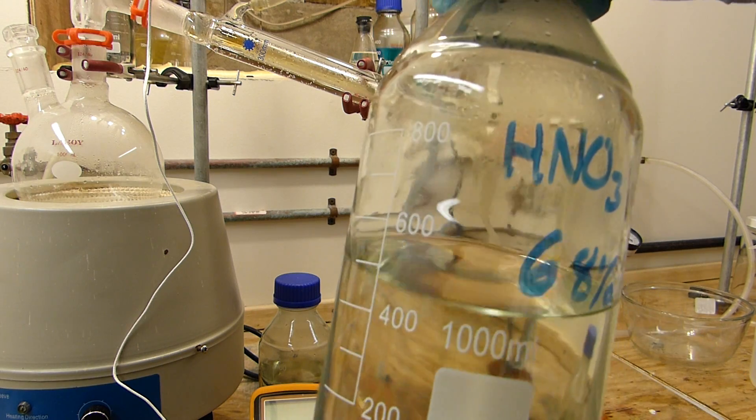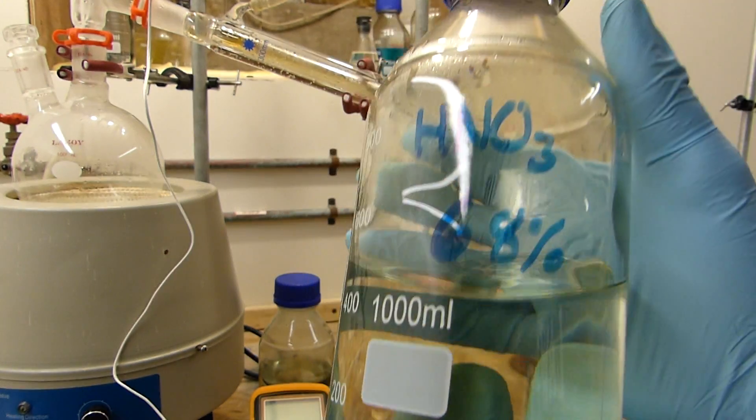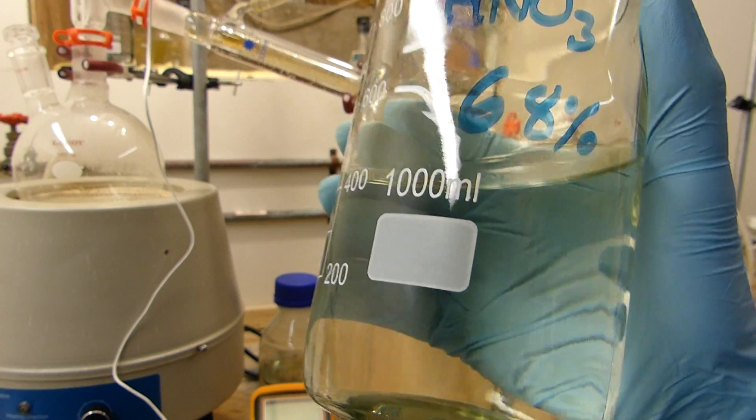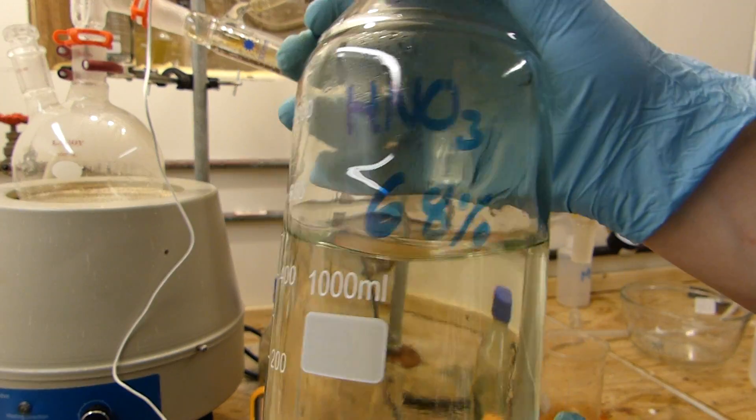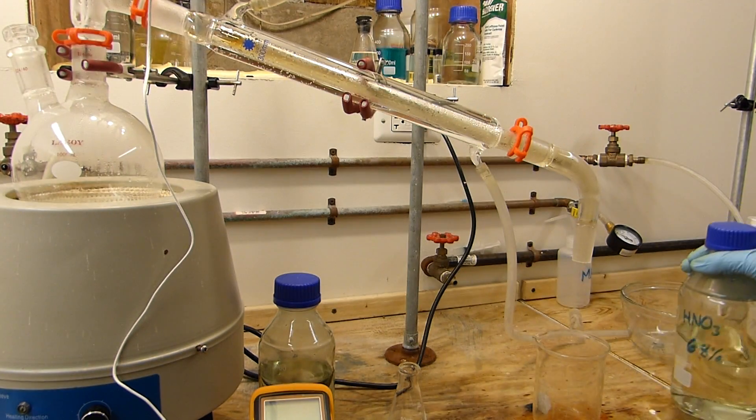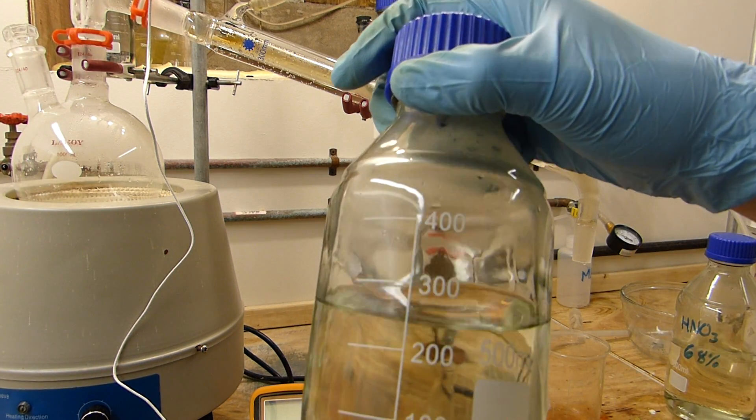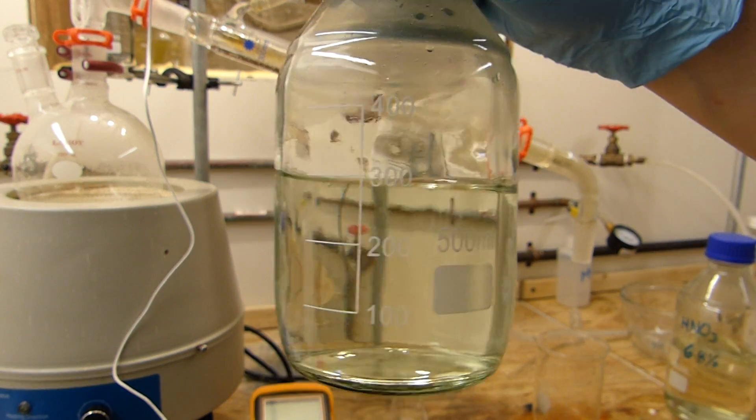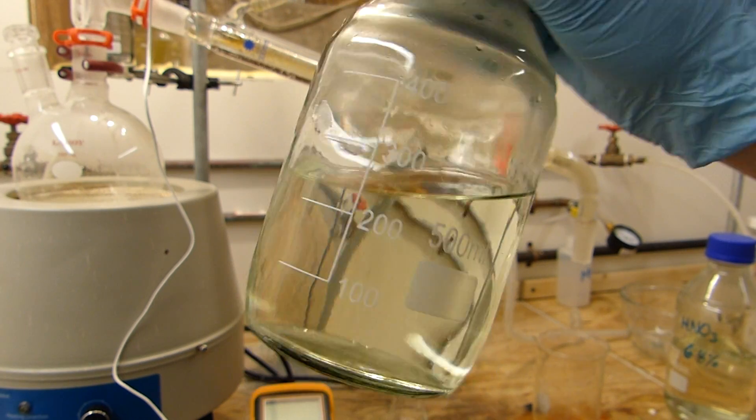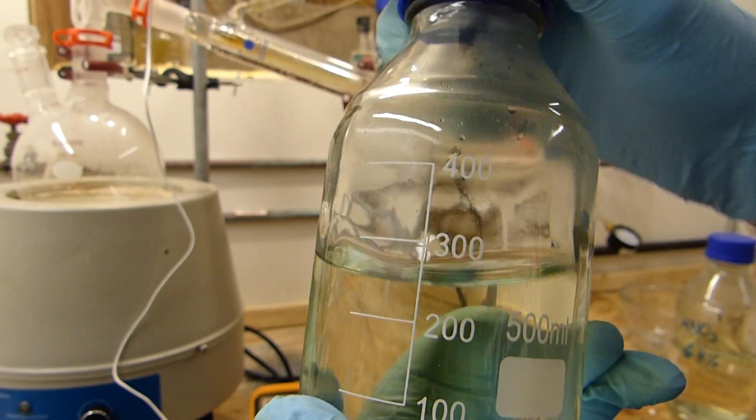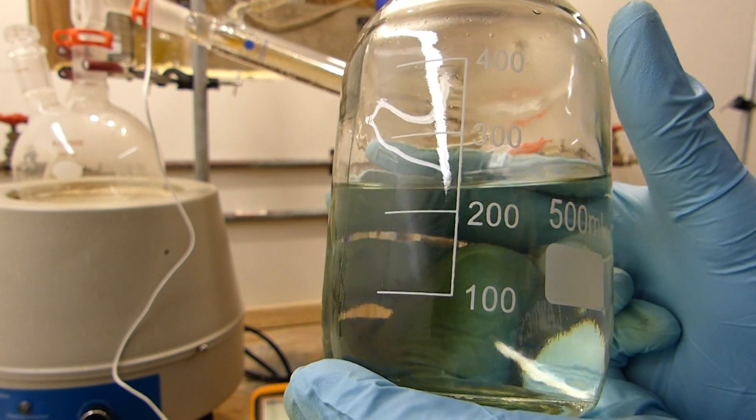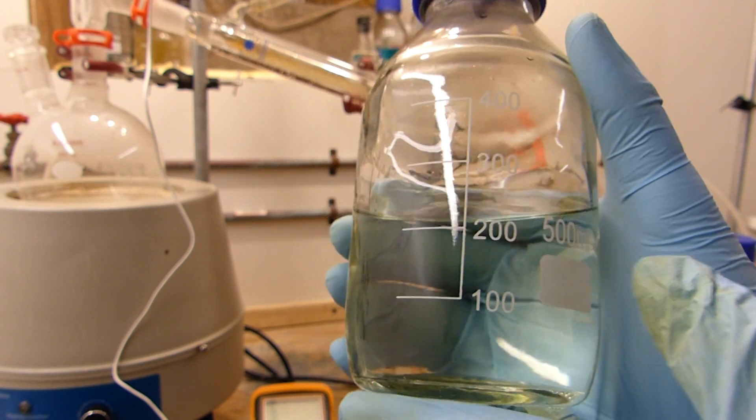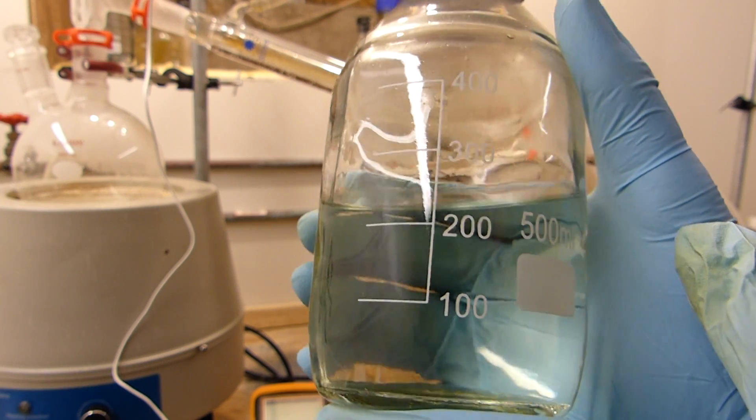So this is the final yield of nitric acid. You can see I have just under 600 milliliters added to the right about 200 that were left in this jar of nitric acid. Of course at 68% azeotrope, fairly clean, it's actually quite clean because it's been distilled, and this will be ready for making organic nitrates or nitrate esters, things like that, for a number of upcoming videos. I also now have a small amount of, actually 300 milliliters, that's not really a small amount, of right around, I'm guessing this is about 25% nitric acid. And this is the forerun of the distillation. You can see there's a little bit of nitrogen oxides in it, it's got a slight yellowish tinge. And you shouldn't throw this away because this is good for making inorganic nitrates. As long as you have the time to drive the water off of the salts that you form, you can use this to etch metals and things like that. It's actually really good for that.